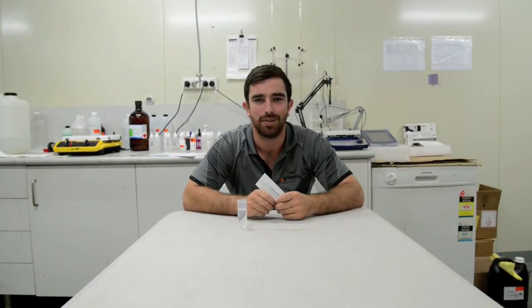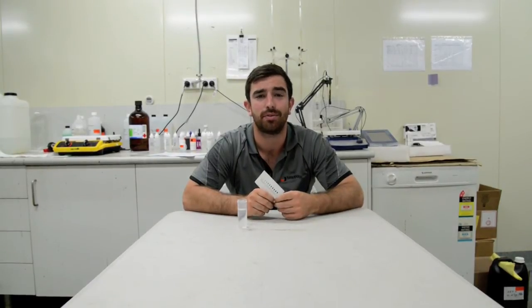Hi, I'm Derek from testkits.com.au. Today I'm going to walk you through how to use our free chlorine test strips.